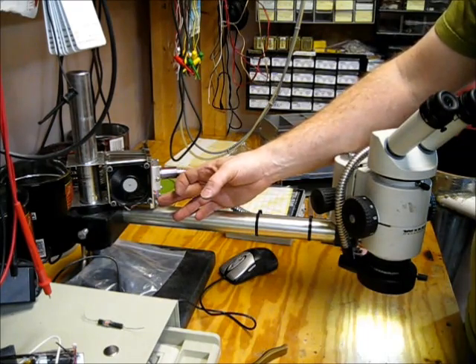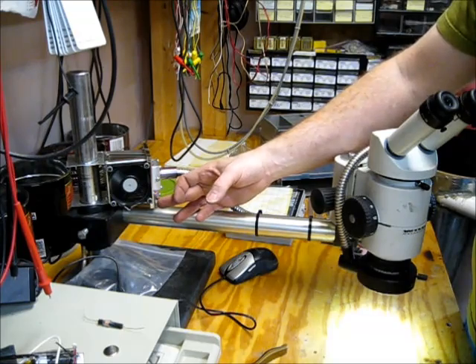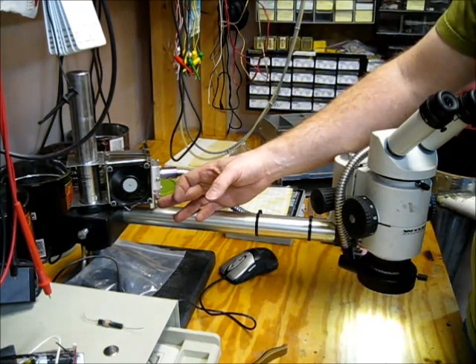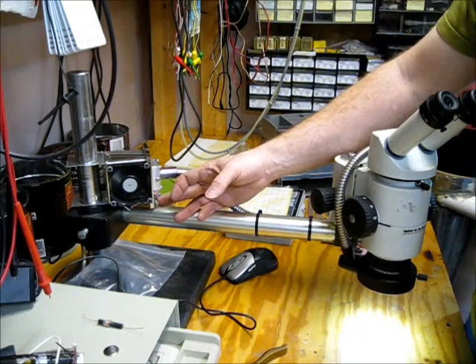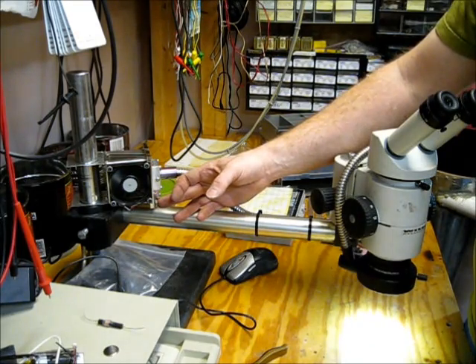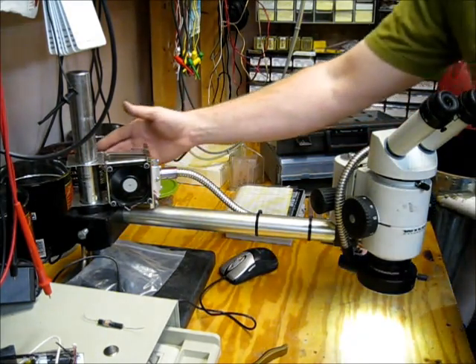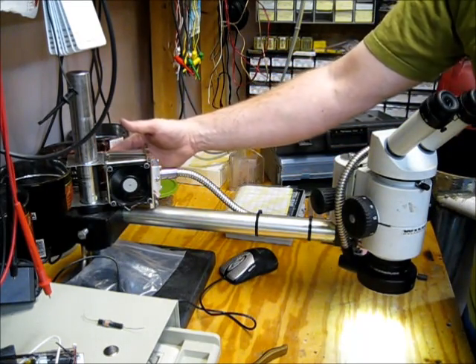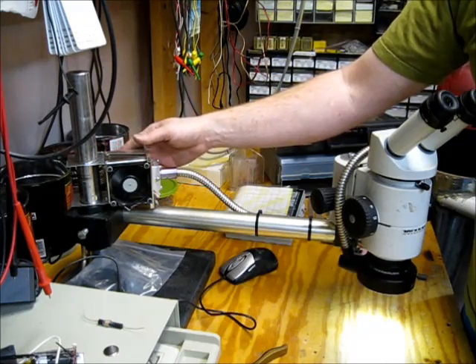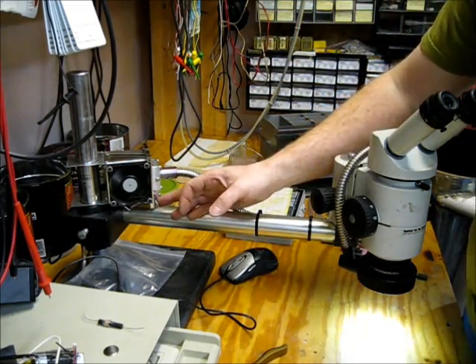Then you've got step up and step down through 10 levels of brightness. And right there you can hear there's the high speed and there's low speed. So again, this all can be adjusted through software on the micro, but this isn't putting a whole lot of air out at this speed, and the heatsink now stays ice cool no matter how long I let it run.